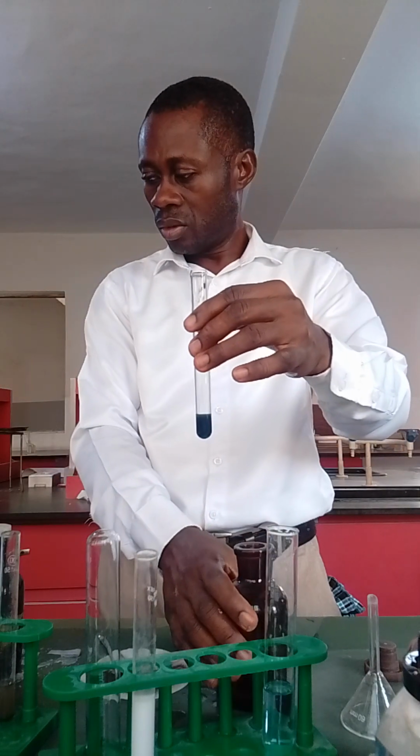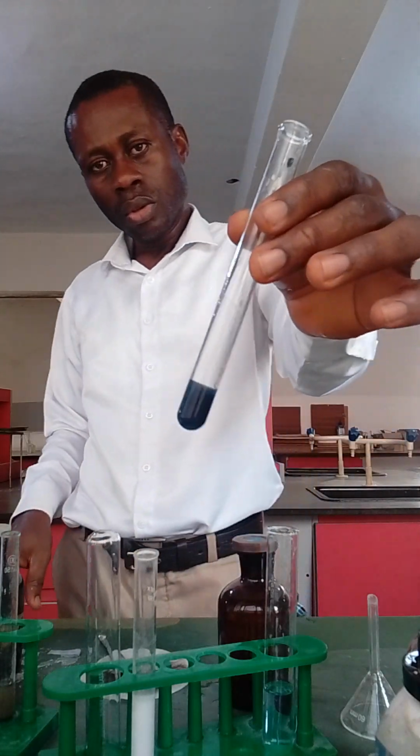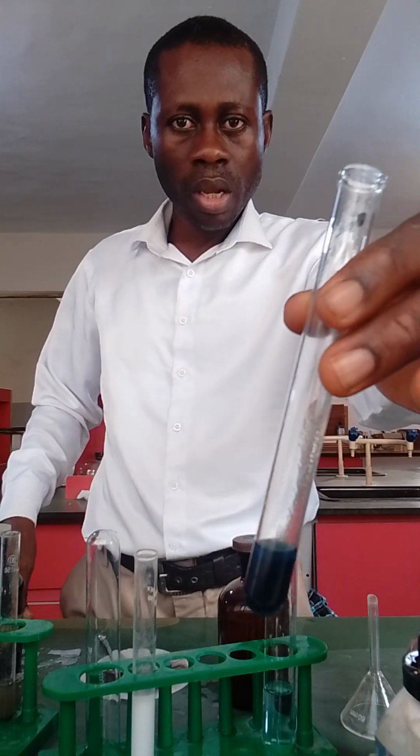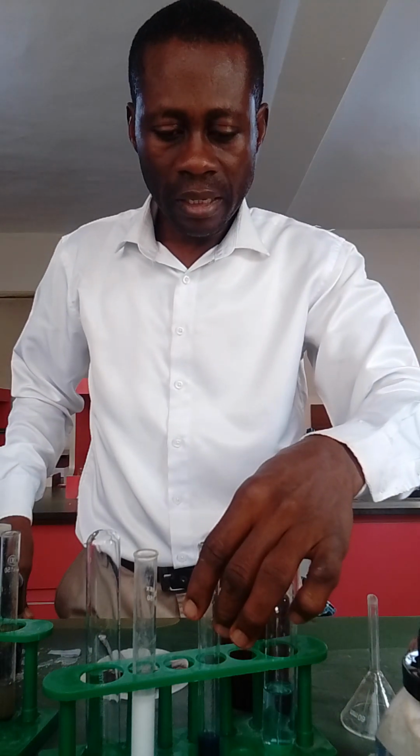and under your inference, you put Cu2+ present, Cu2+ confirmed. All right. So this is the analysis. I'm going to write it out and also paste it for you to see. Okay, this is how far we can go to help you study it and expect the best tomorrow.